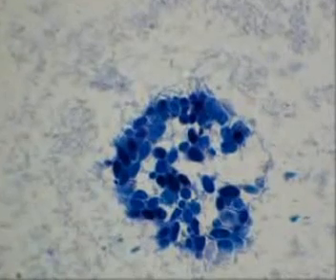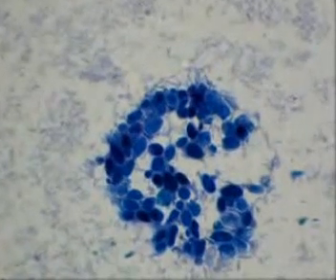Now we get a good picture of those E. coli cells. They look like little hairs compared to the larger oval shaped yeast cells.